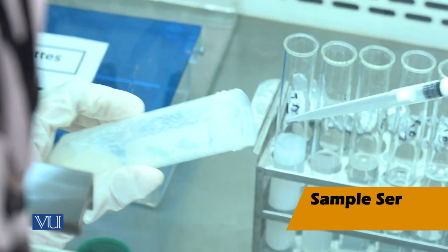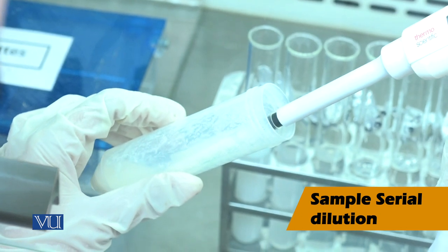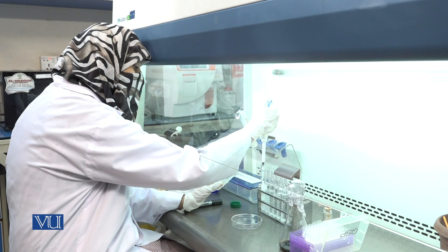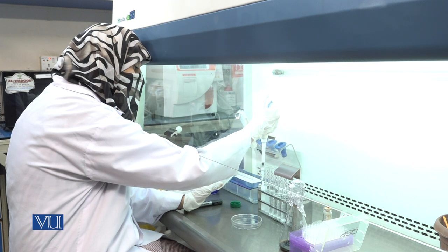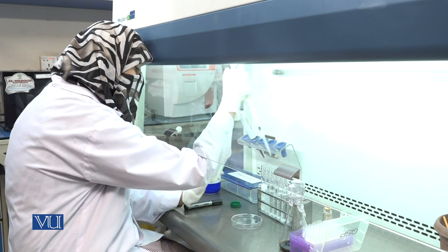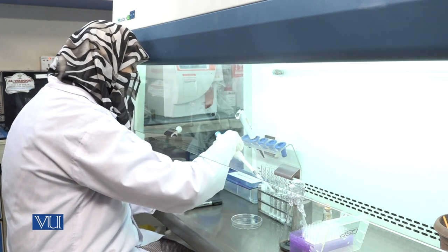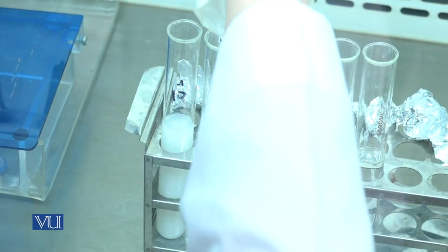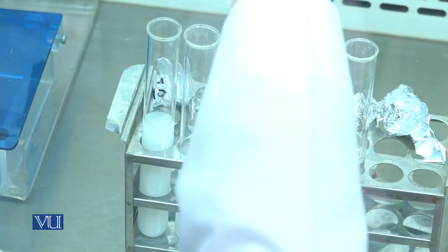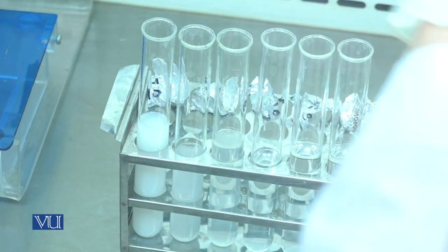Take 1 ml of milk sample and add into the first test tube. Mix the sample, then by using a similar procedure make 6 serial dilutions.